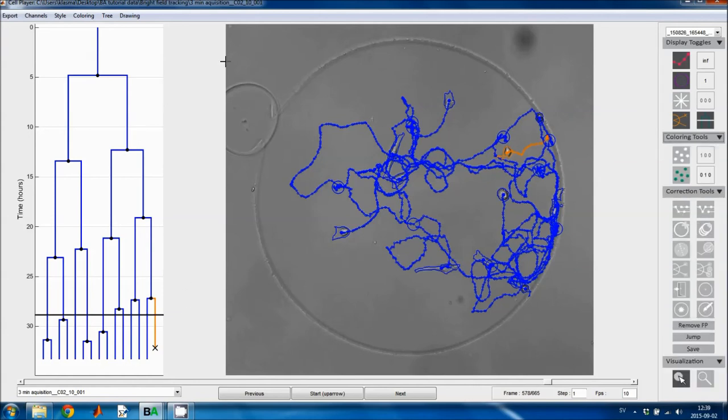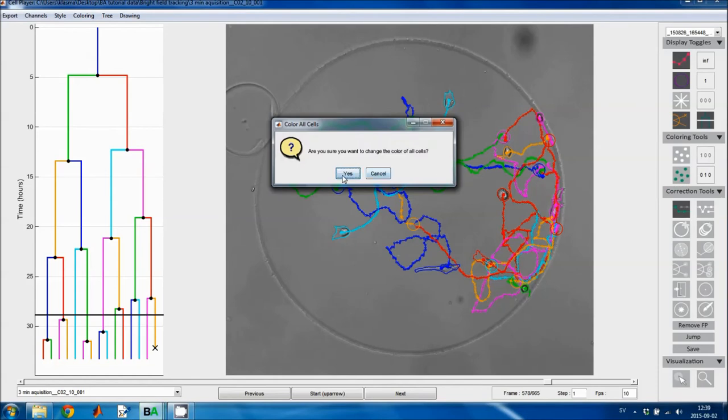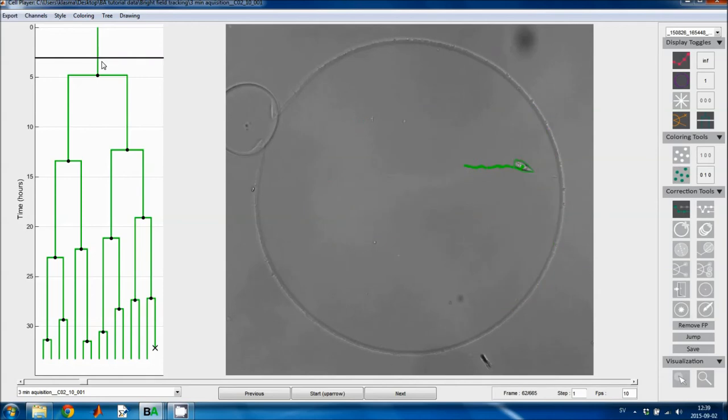And then if you want to permanently color the cells, so this is just a temporary coloring, you can use these coloring tools. This tool will color all of the cells in the same color. In this case we have 1 on the green channel, so this is gonna color all of the cells green. If I press this button, click OK, all of the cells become green. And then I can choose to color a single cell in a different color using this tool. So I select the tool and specify a color that I want to color the cell in.